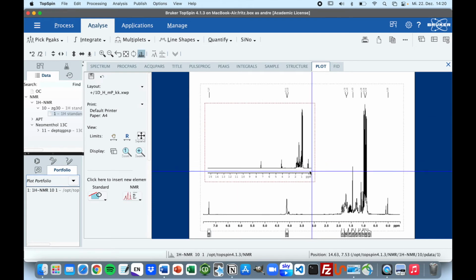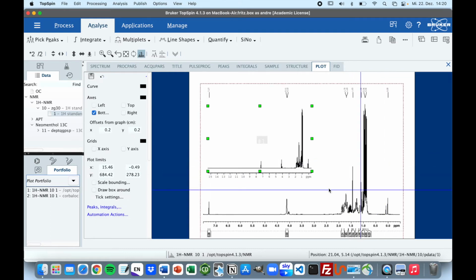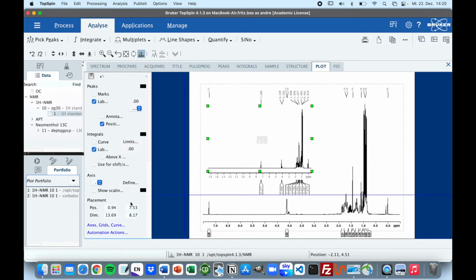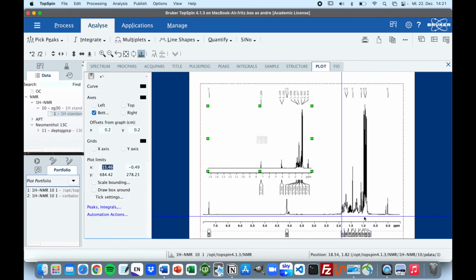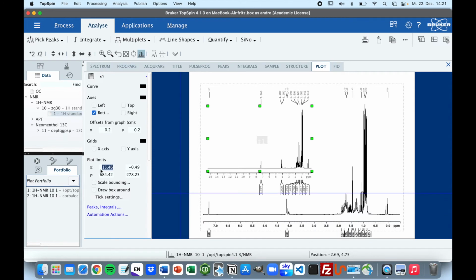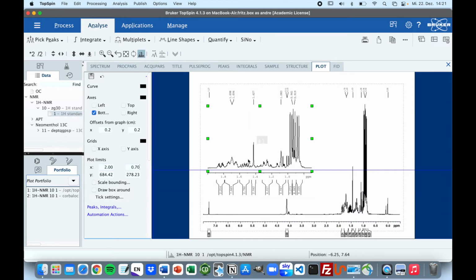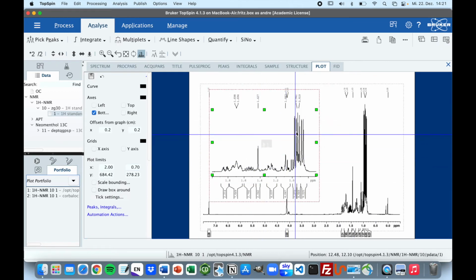And as you can see, it's the same as the one we had before, but it has a different size, and we can change settings the same way as we did before, but on here we don't have our peaks and integrals labeled, so we'll just select these first. And now we are going to define our plot limits, but we will use different ones this time. So we want only this area, so we can say it will start at 0.7 and will go up to 2 ppm. So we'll just select 2 and 0.7, and it already looks pretty nice, because now you can really see which integral belongs to which signal.